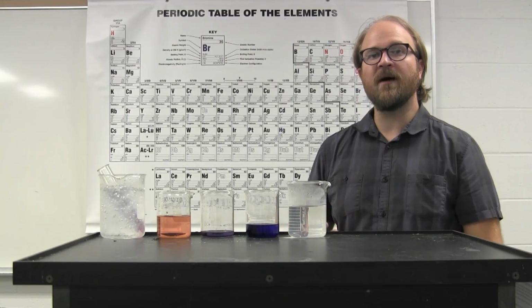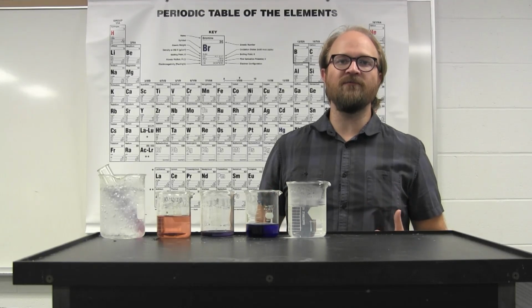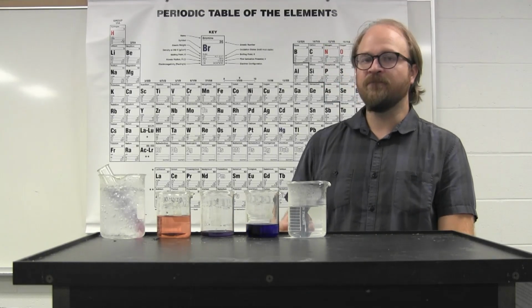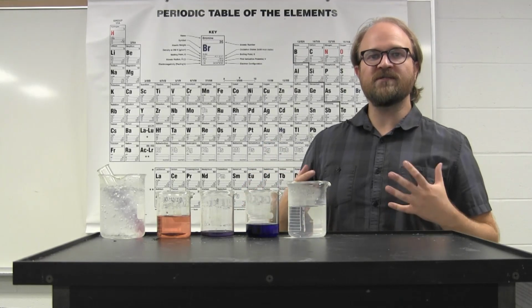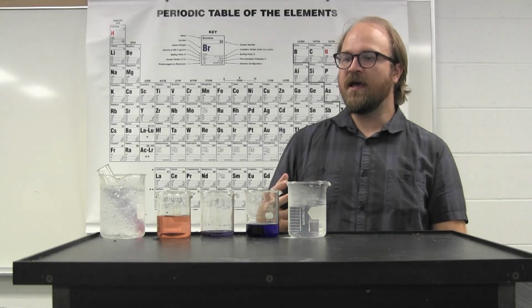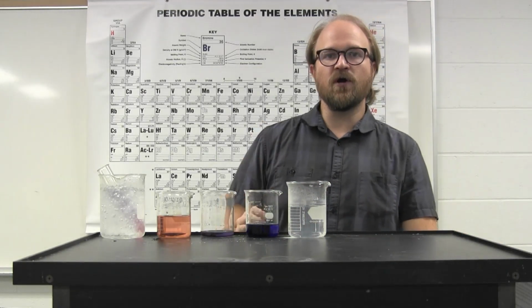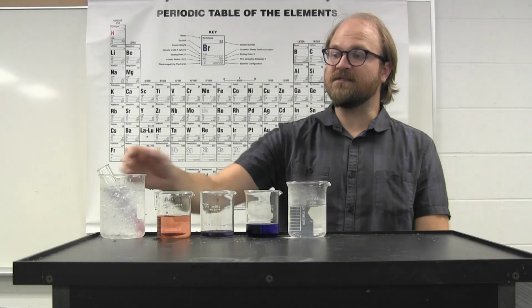This experiment combines a number of different concepts that you've gone over in Chemistry 2. It's taking an equilibrium reaction, which is prepared using different moles and different ratios, and you're determining the equilibrium of this at different temperatures.